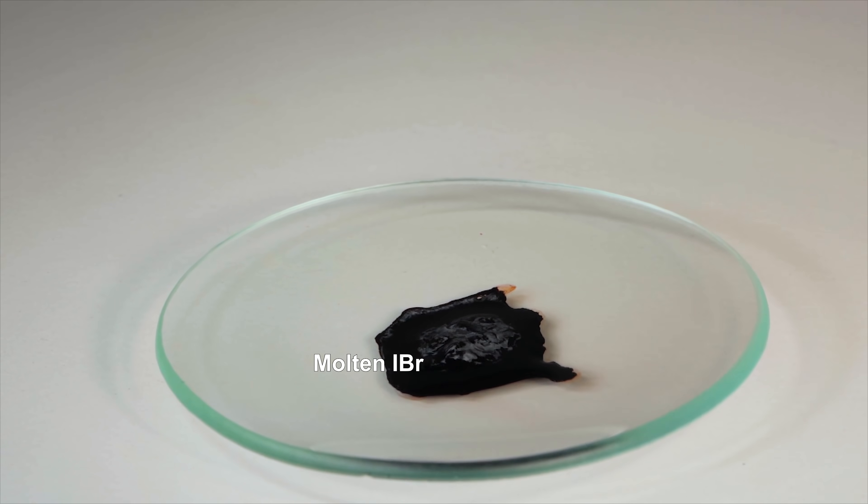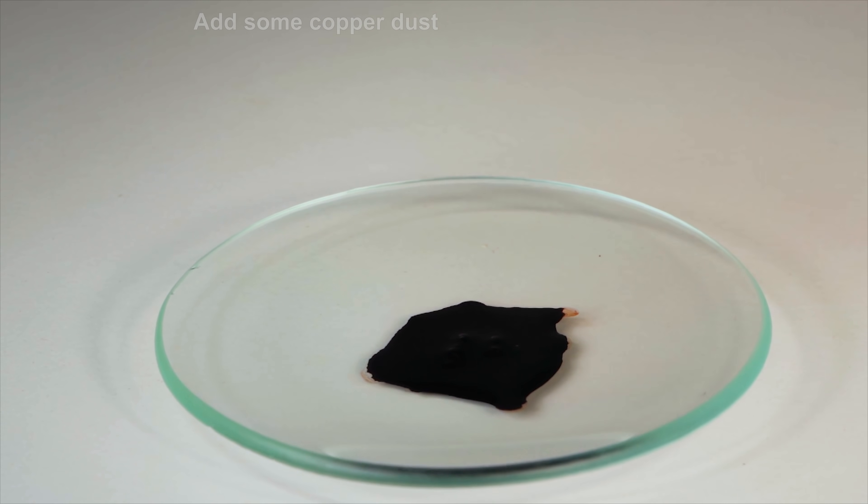Copper powder reacts with melted iodine monobromide pretty actively too, but there is no explosion.